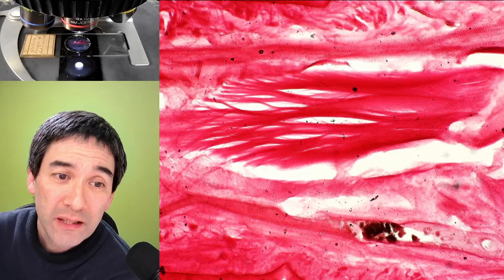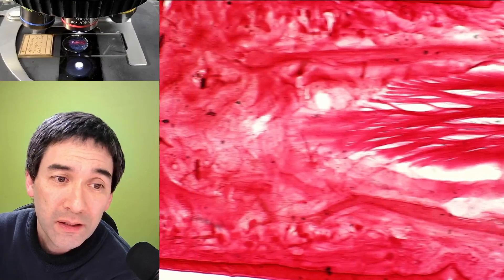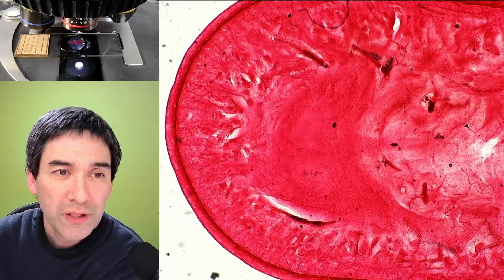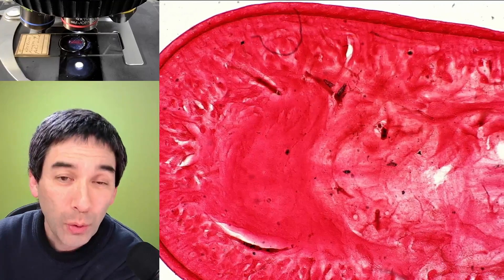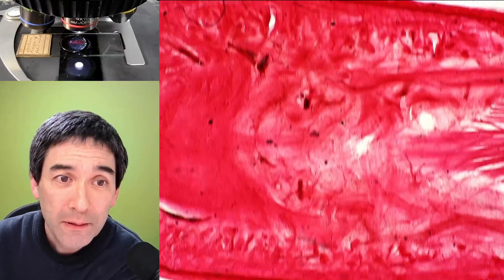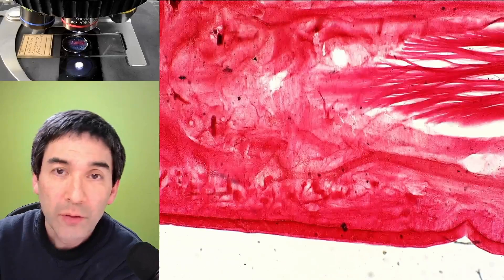Over here, these are most likely tendons or muscle fibers as well. And you can see it's been stained. What we see over here is that it basically stops all of a sudden, which is a little strange — shouldn't the finger basically go on? Well, the reason is because this is a very thin cross-section; it has been cut diagonally. And when we zoom in a little bit more, we can also look at the different layers of the skin.